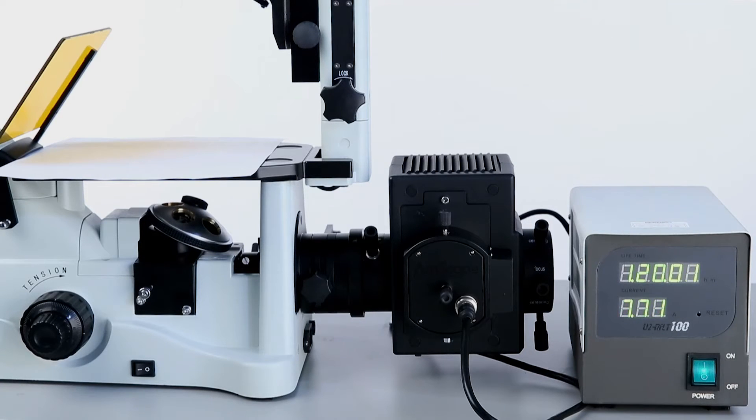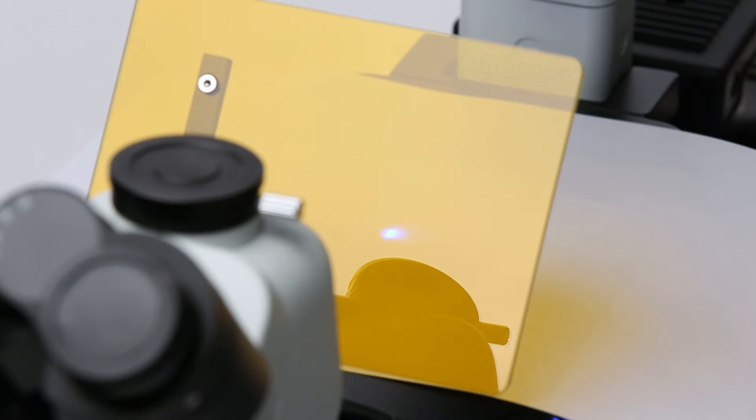Once everything's set, you can power up the lamp. You may want to let it warm up for a few minutes to get to optimal output. I recommend using the eye protection filter due to the high intensity light.